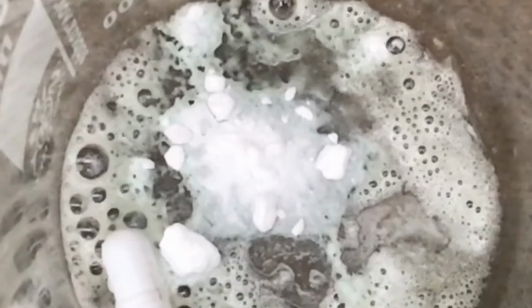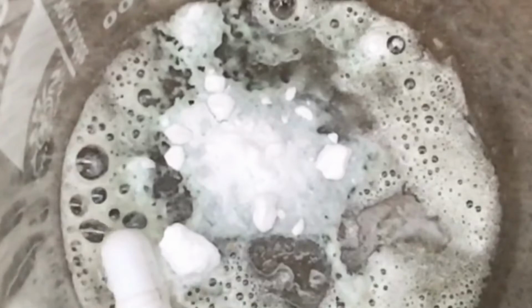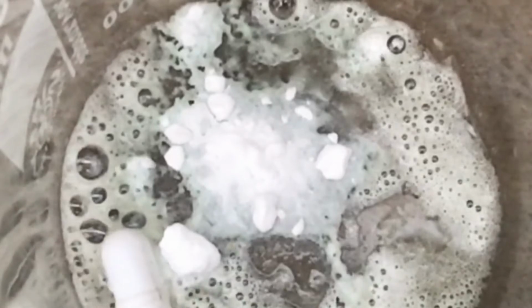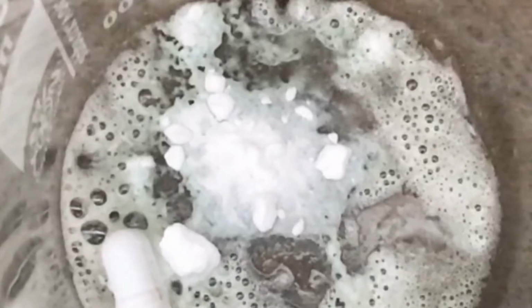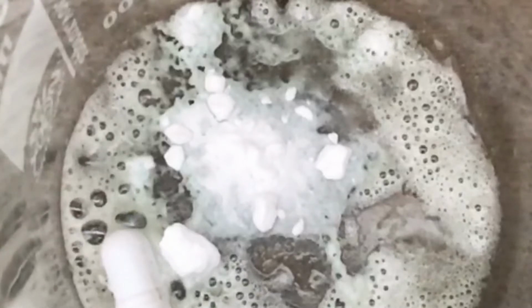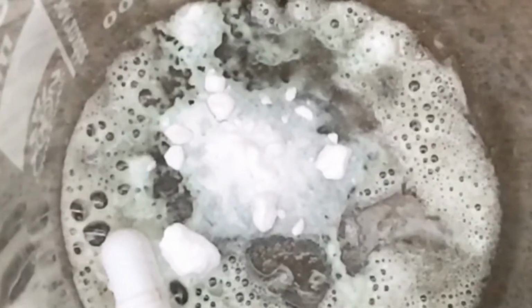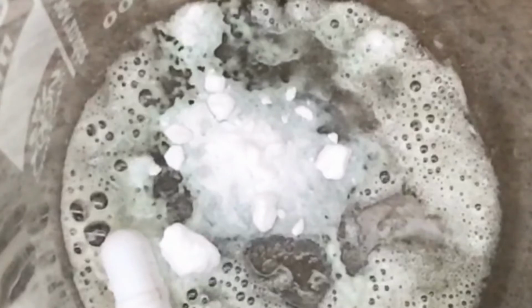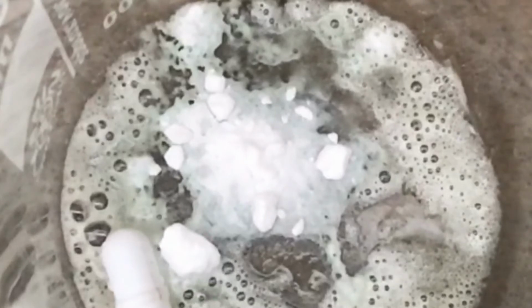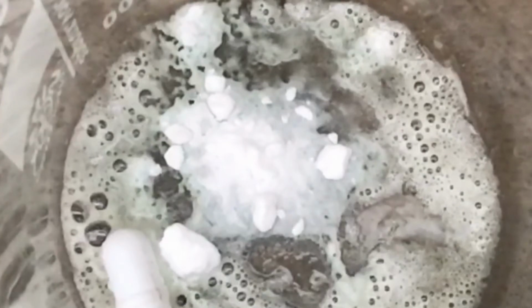So, is this method actually worth your time and effort? Well, there are a few problems with this method. First, it produces quite a lot of copper waste, which isn't really ideal. Second, it is kind of slow and inefficient, so you need to have like industrial scale to produce any large quantities. So I would not really recommend it, but if this is your only way to get sulfuric acid, it's a reasonable way.